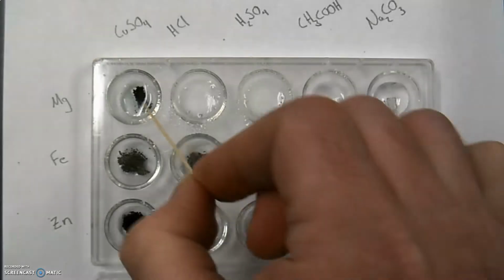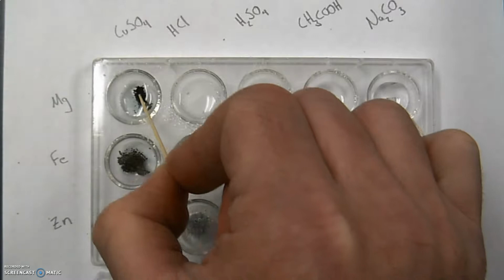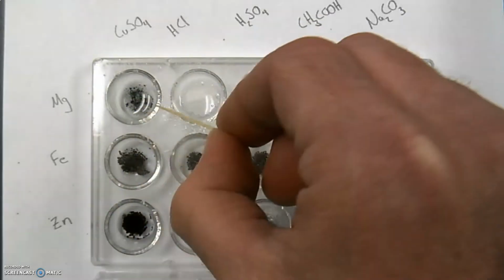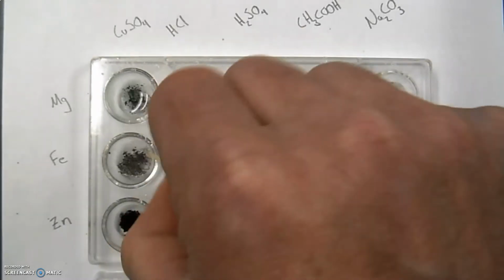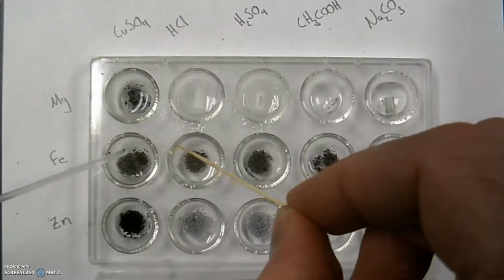If you see a physical change, which I definitely see here, you have this crusty stuff forming on there. That's a reaction going on. And I can see that throughout some of these blue ones. And also, the fact that you're putting a blue solution in here and then the blue solution is gone, that's a change. And I'll add some more in here just so we can see that a little bit better.